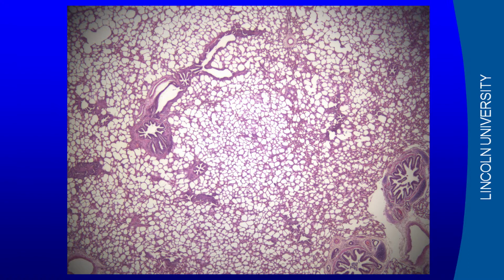So all of this is air sacs, and these structures here are airways which are supplying the air to those air sacs.